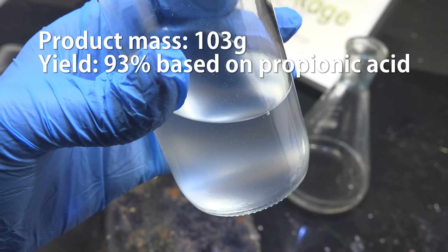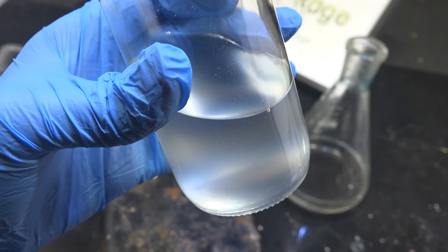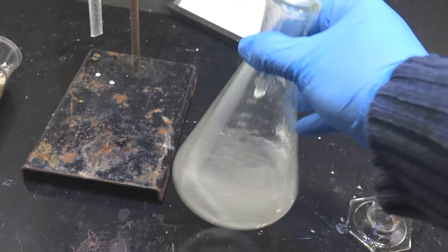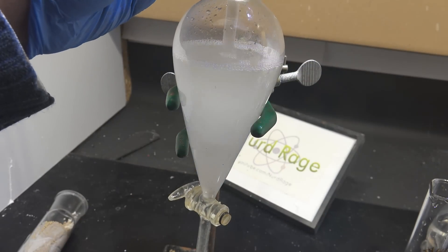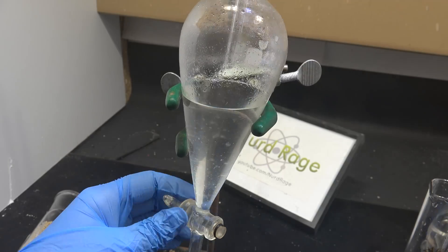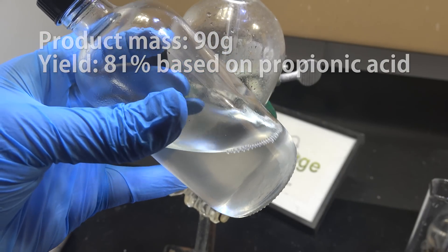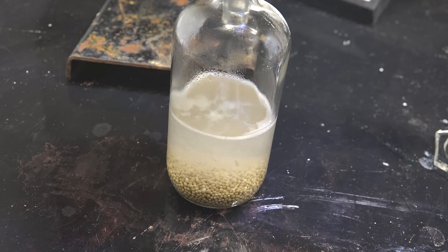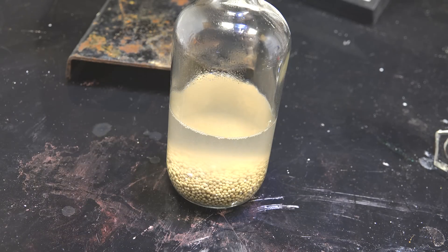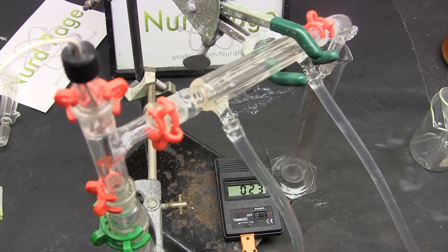This is a tremendous improvement over the direct method that only gave 40%. Now granted this 93% is grossly impure, but so was the 40% of the original method, so we can still compare them. To improve purity somewhat I'm going to wash it again with 100 mL of cold water — the most likely impurity is ethanol, which while soluble in water is also soluble in ethyl propionate and usually doesn't wash out in a single run. After separating again this is 90 g, or about 81% yield — still ahead of the original method. I'll store the crude ethyl propionate over molecular sieves to remove the water, as I'll need it water-free in future experiments. There is likely still a few percent ethanol remaining, but that's acceptable for what I need. If you want to remove the ethanol you can fractionally distill the ethyl propionate.